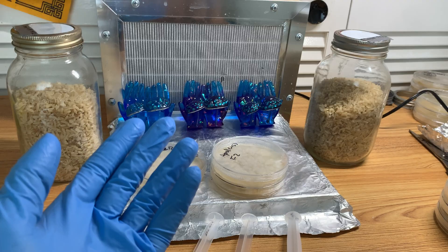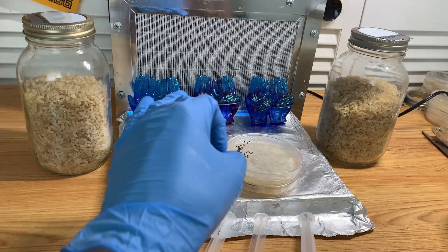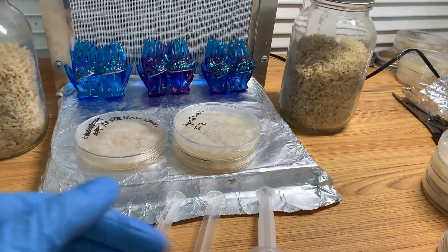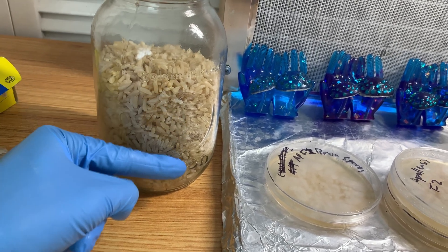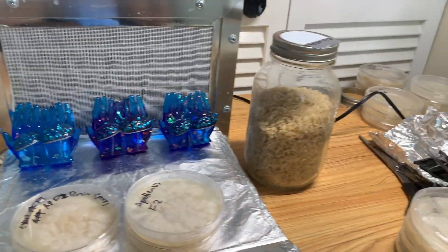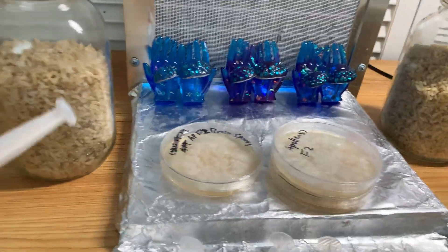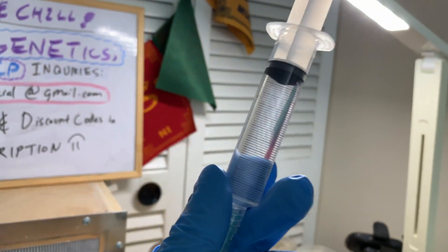If you take a spore print from fruits you just got, make a syringe within the month, and then inoculate your grain jars, you'll often get germination very, very quickly. Personally, by the end of day two I'll start to see mycelium popping up, and by the end of day three it's like a carpet of mycelium wherever I inoculated. My spore syringes that I make for my own use are practically clear, but there are still tons of spores in there — and I'll get a carpet of growth very quickly.